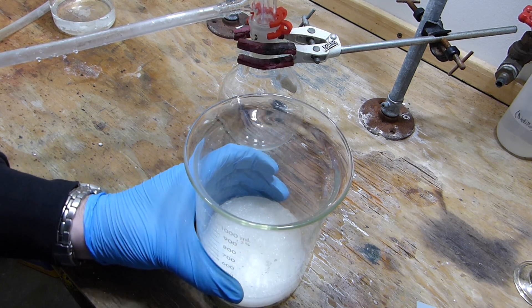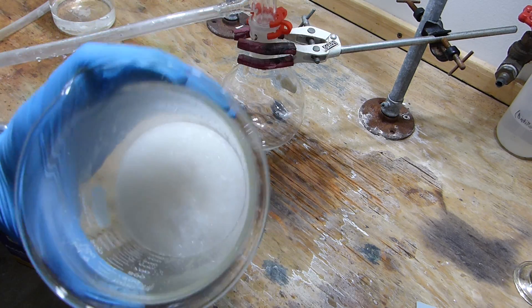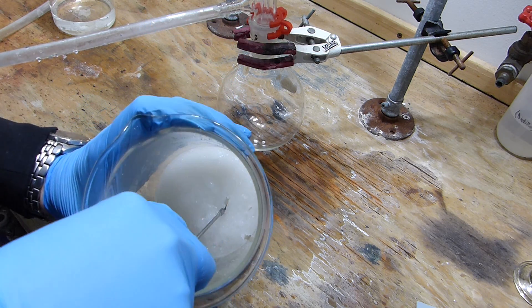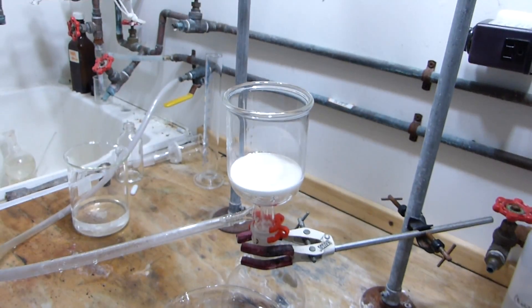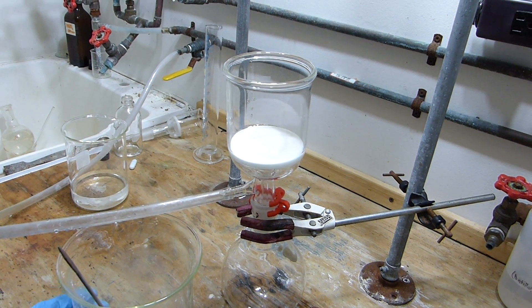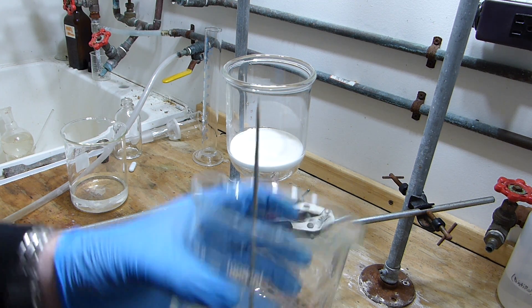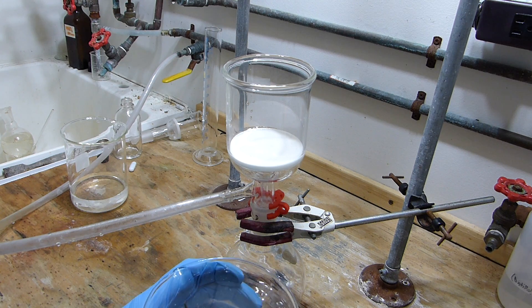All right, so I just got this out of the freezer and it's very cold now. You can see that it's solidified into a pretty much solid mass of hard crystals — it's actually sort of soft, I can poke holes into it — but I'm going to have to break this up and get it stirred up so that I can vacuum filter it. You might be able to see that I've already set up for vacuum filtration right here with just a Büchner funnel and a 500 milliliter collection flask.